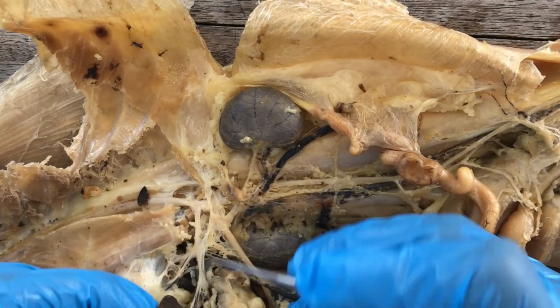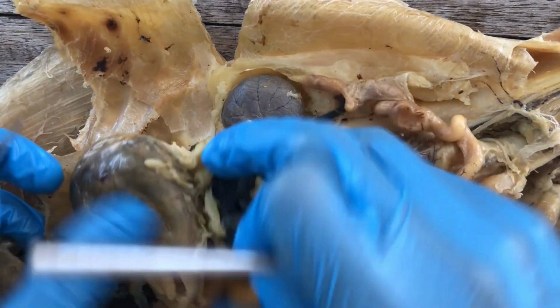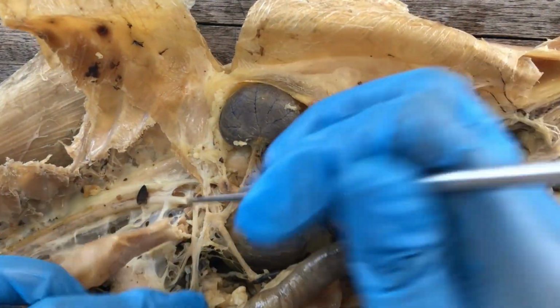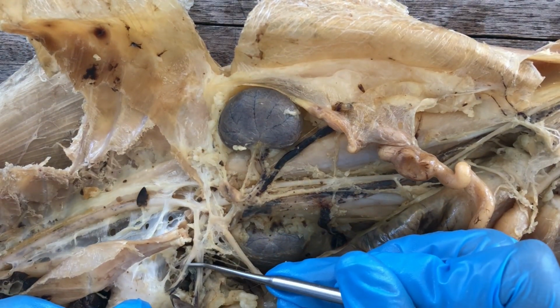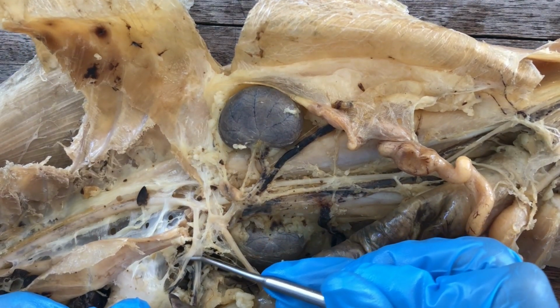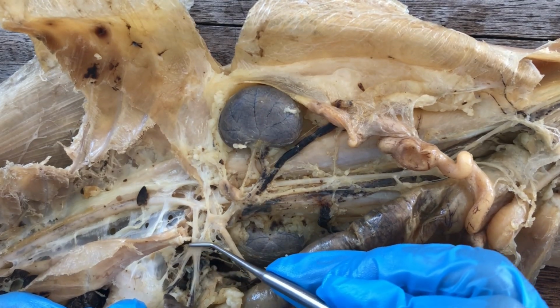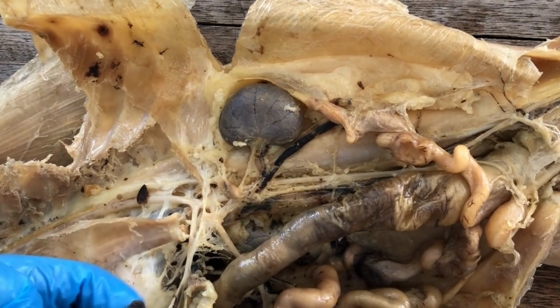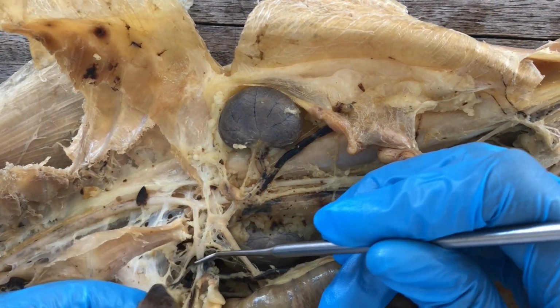And then one branch goes to the stomach, that's the left gastric artery or the coronary artery. And then one going to the spleen, that's the splenic artery.